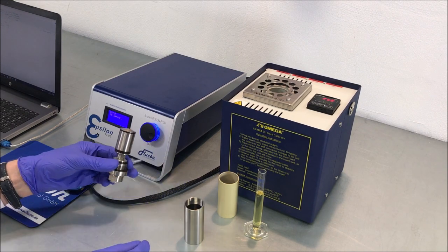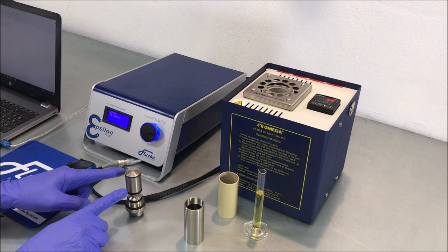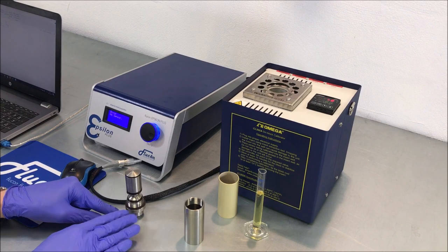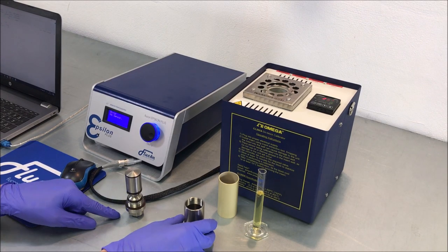Set the sensor aside carefully. Make sure that you do not touch it so its sensitive surface remains dry and clean.